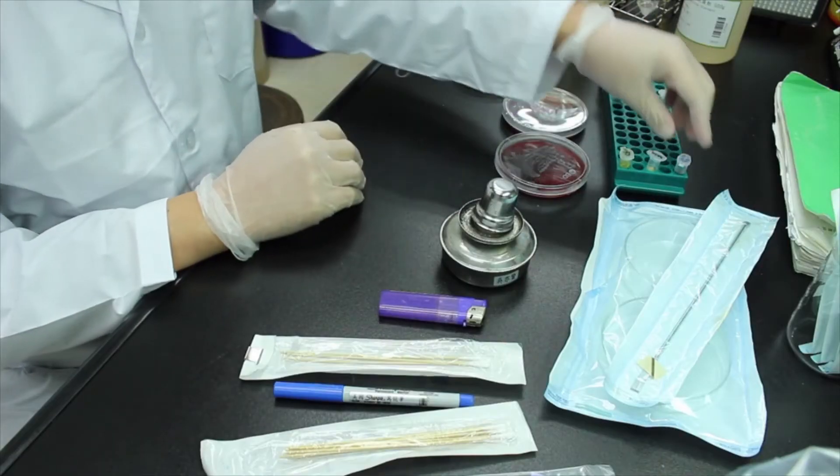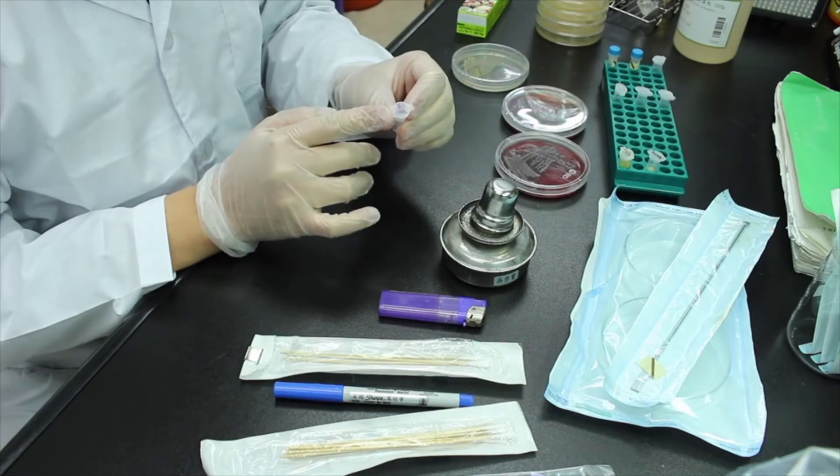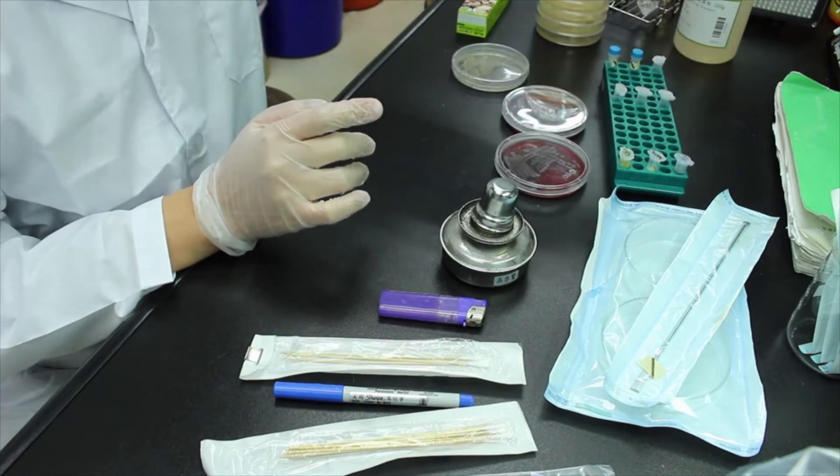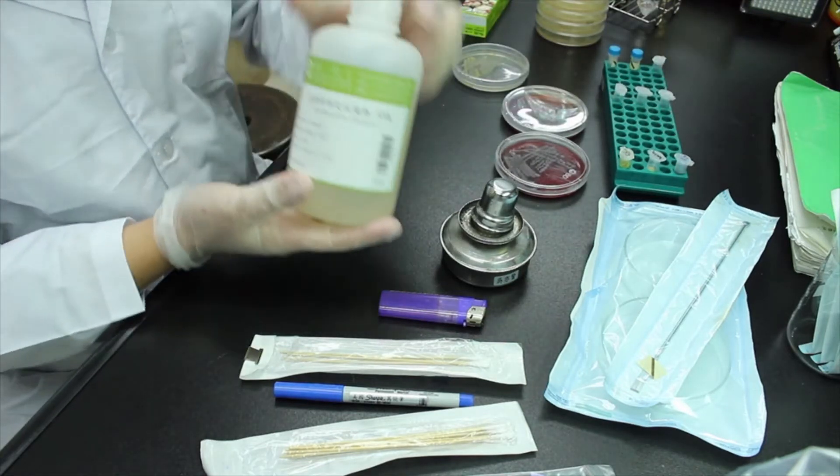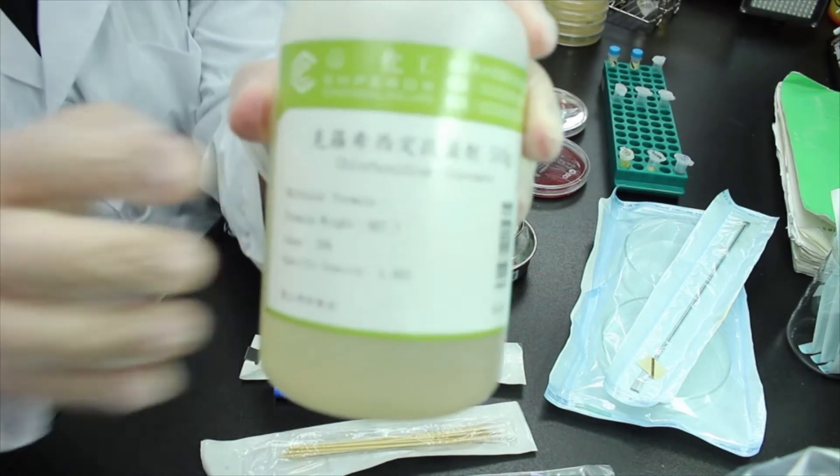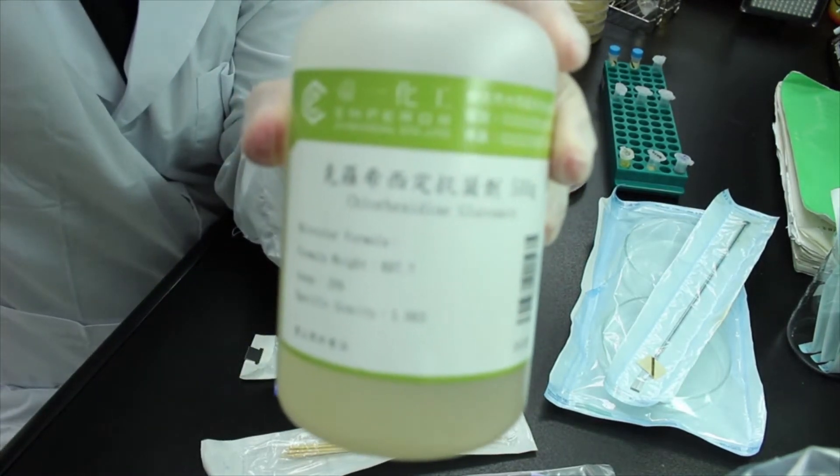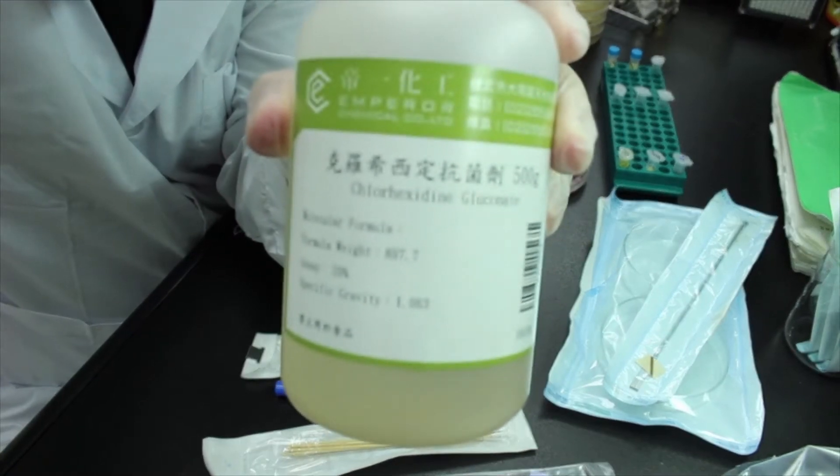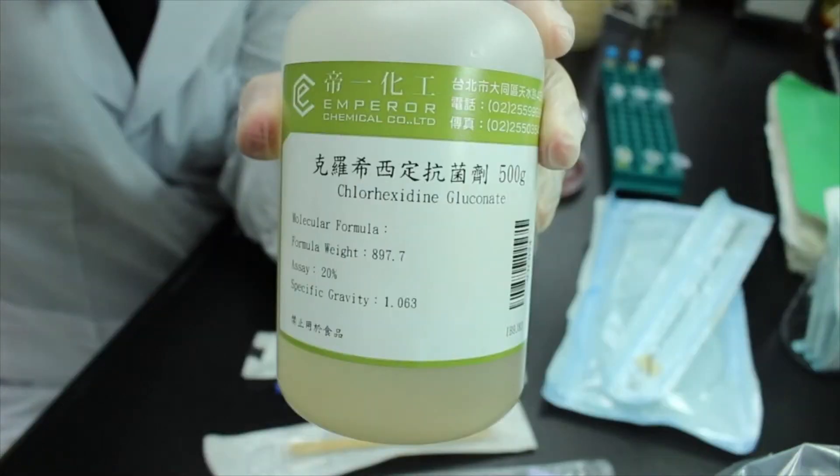And as for the control, I'll be using this. It is called chlorhexidine, which is a very common antimicrobial agent. And this one is 20%, and I will dilute it into 4%, which is the concentration used for skin disinfection before surgical operation.